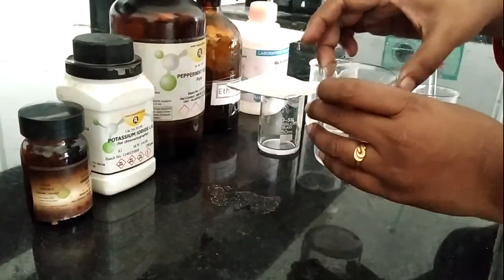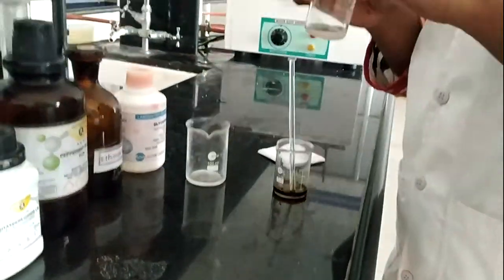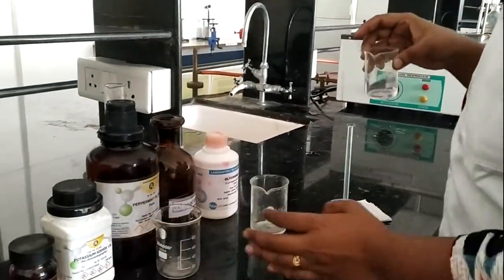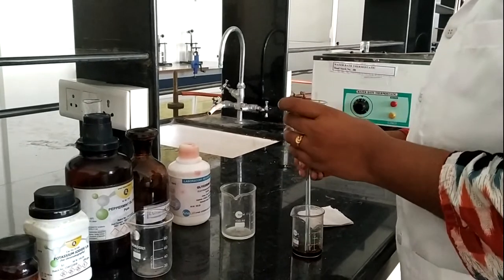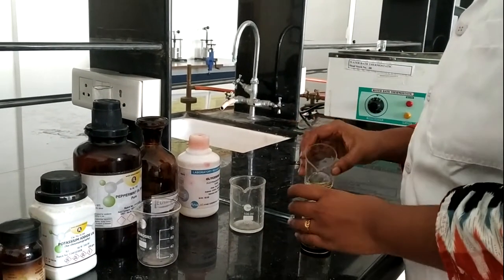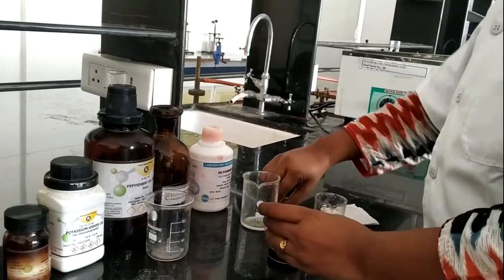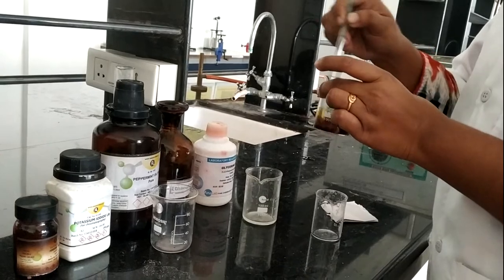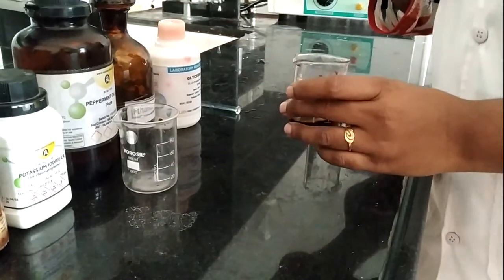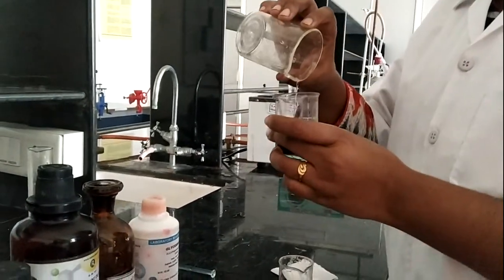In the second step, add peppermint oil into the alcohol. After proper stirring of this mixture, add it into the previous iodine solution and again stir vigorously. Then in the next step, add glycerin into this previously prepared iodine solution.